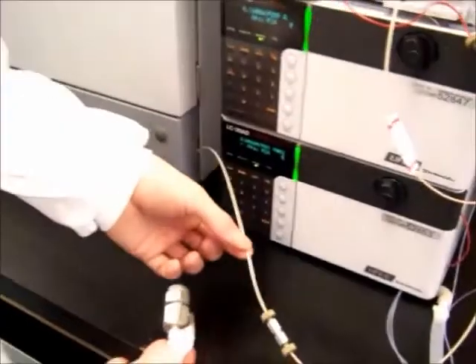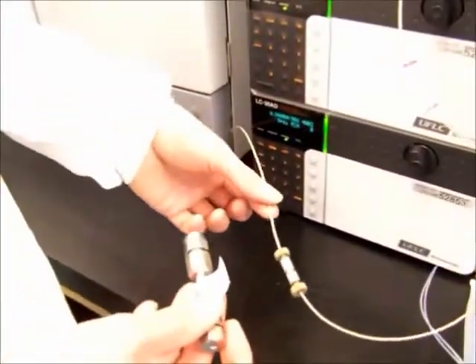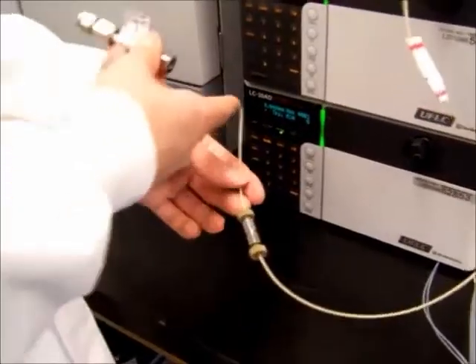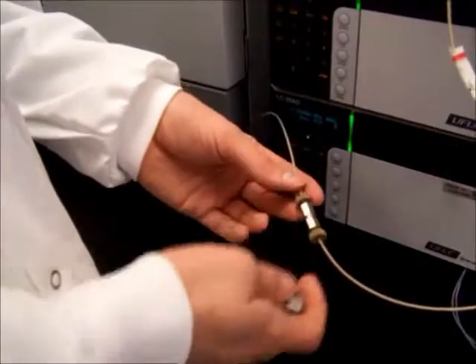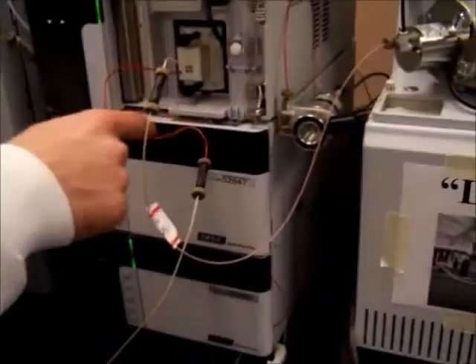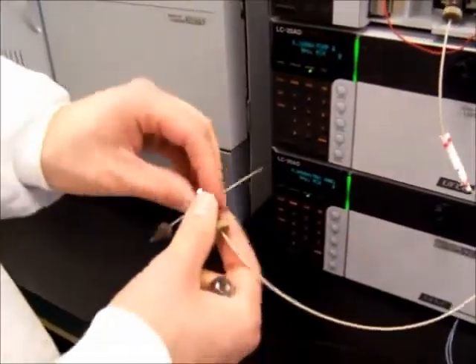When the LCMS process is taking place, at this point the solvent has been pre-mixed and it's moving through. The solvent and the analyte have come together, they're mixed together, and when you reach this point, this is where the separation occurs with the column. And if you'll notice, it's right before the PDA, so it feeds into the PDA here. So unscrew the tubing.